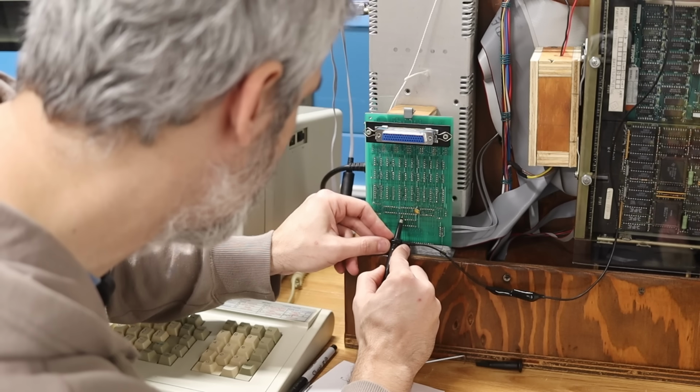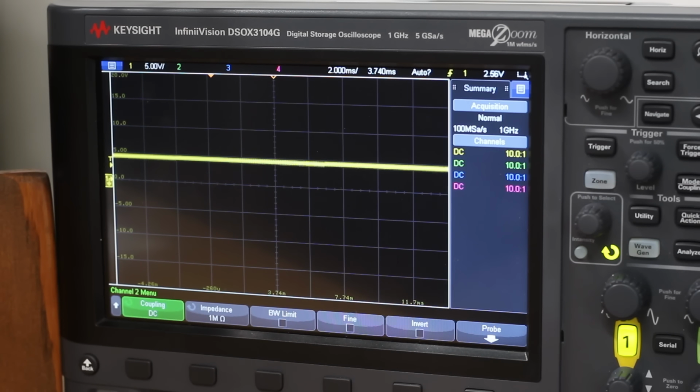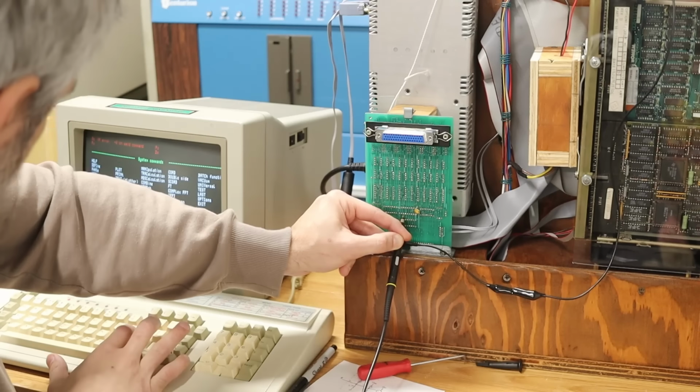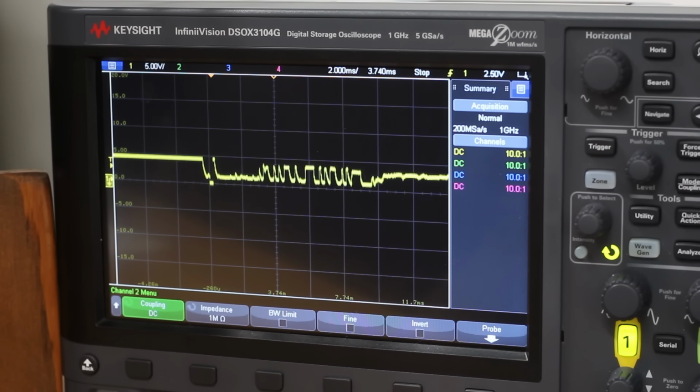So if I put my probe on pin 15 here, that does not look good. Oh, now it went fine, but it was dancing. Oh, there it goes. It's dancing around a little bit. Let's try to get a scope shot on that. So I'll do a single, and then we'll run the phase again here. And yeah, okay, we got some serial data out, but boy howdy does that not look good.